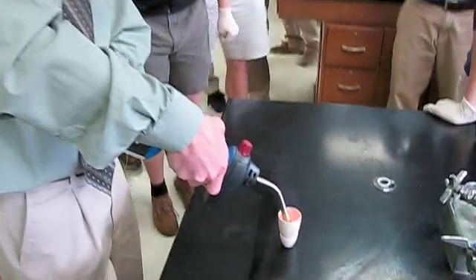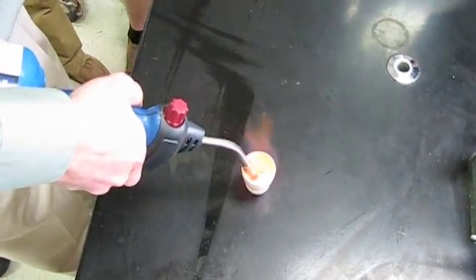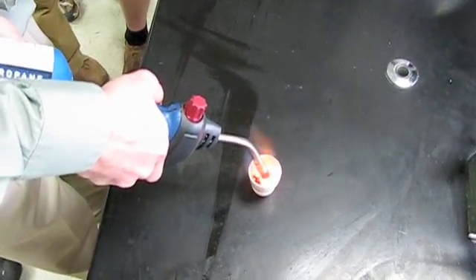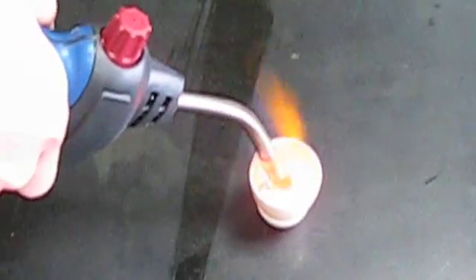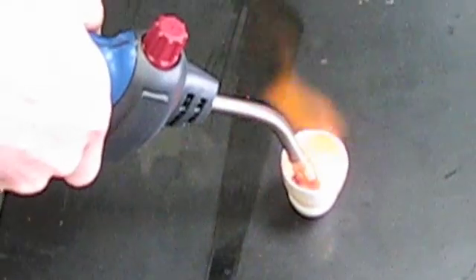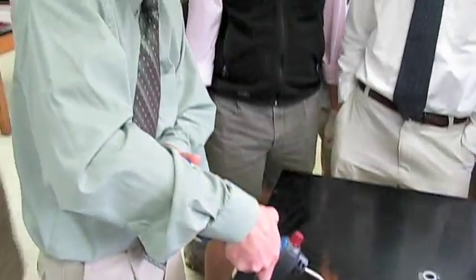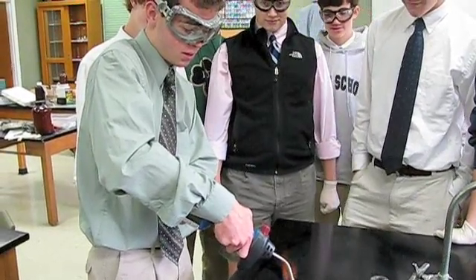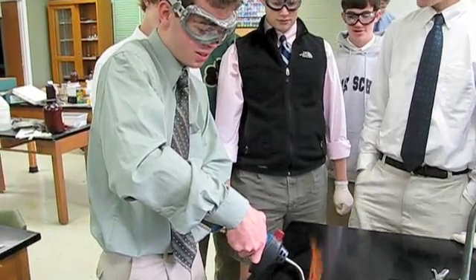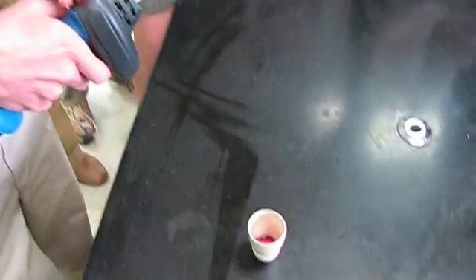Goggles! This is so exciting. Alright, cut the flame off. Let me see what it looks like real quick. It looks like a fake. There is quite a glow. Looks like a crack.